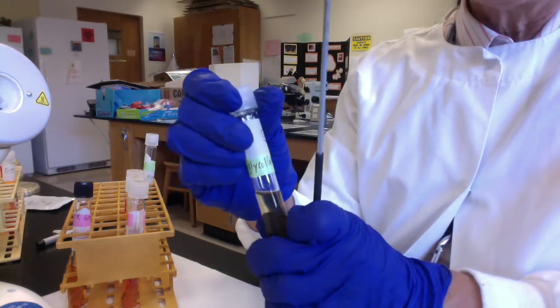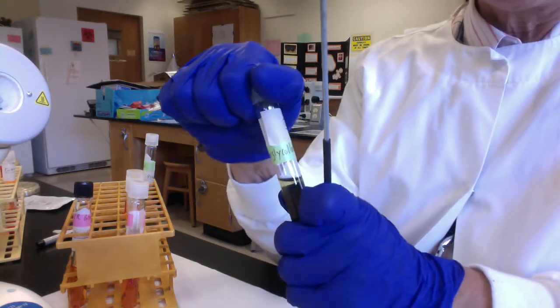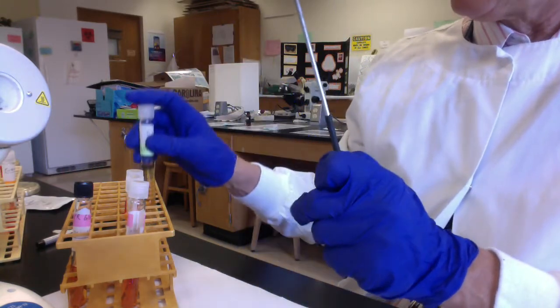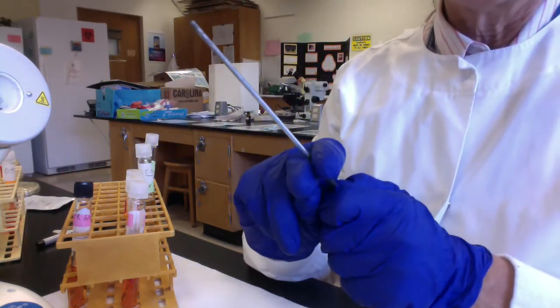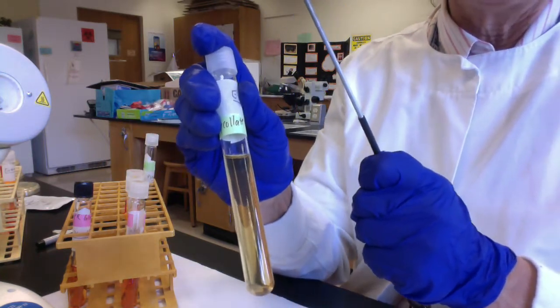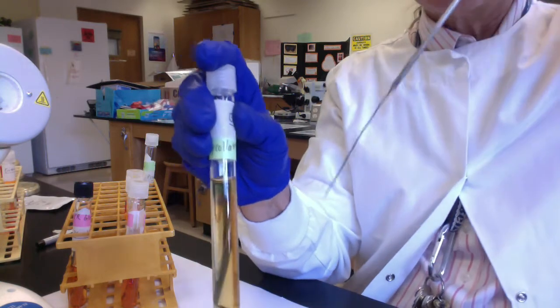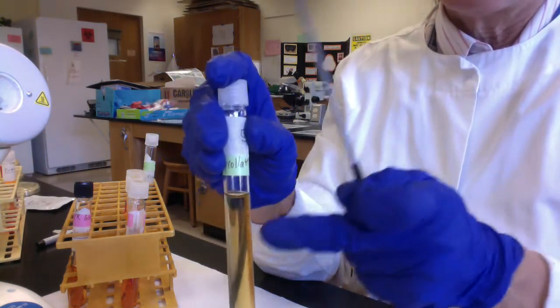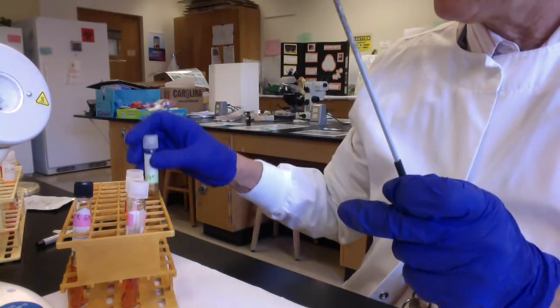So I'm going to inoculate my E. coli, and this time I won't try to swish my loop back and forth, because I do not want to introduce air into my thioglycollate media. So we're really careful. We're going to inoculate straight down and straight back up, and we want to be really careful not to shake the tubes, right?